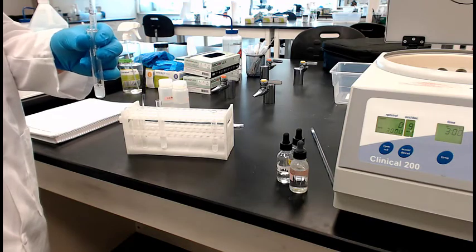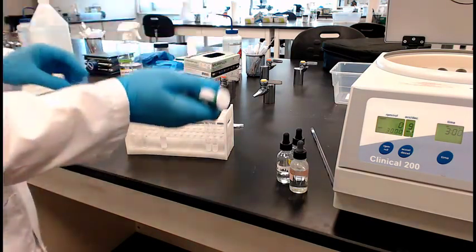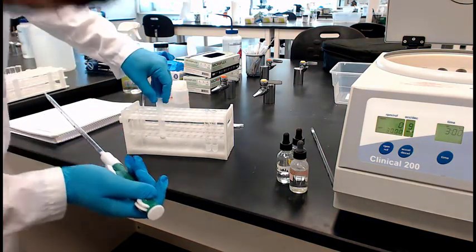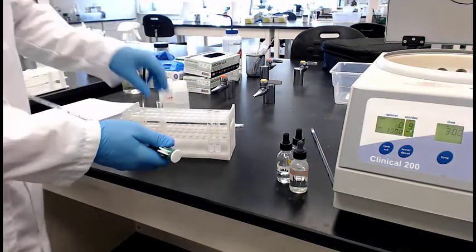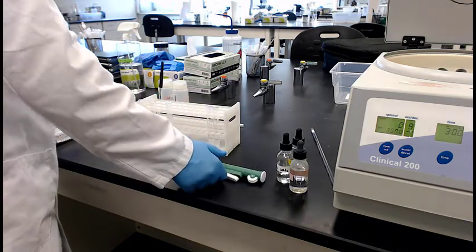So this can go a lot easier. Just dump the rest over. Cool. So we have them about equal. They're 1.5 mils of each. Right now, there's the leftover precipitate. So now what are the next instructions here?